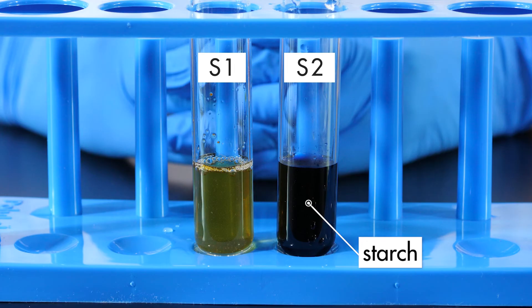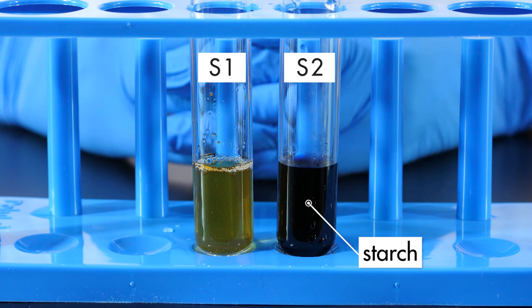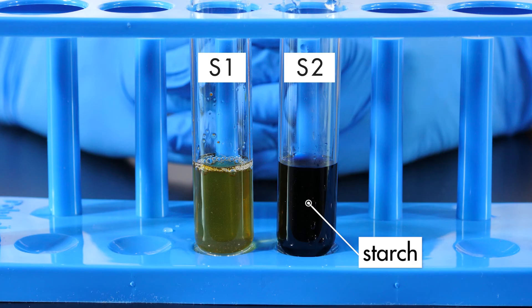This was the expected result, since test tube S2 was the control. We have looked at the digestion of albumin, which is a protein, and the digestion of starch, which is a carbohydrate. In this final experiment, we will examine the digestion of another type of nutrient, called lipids.